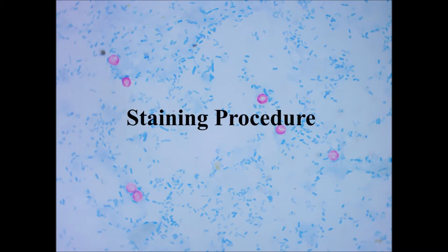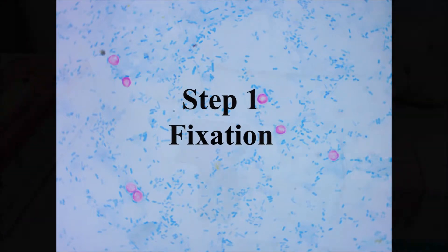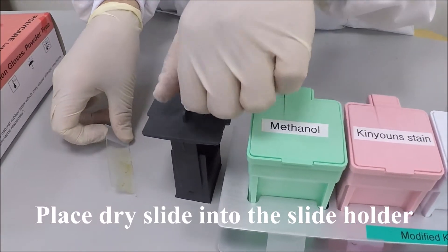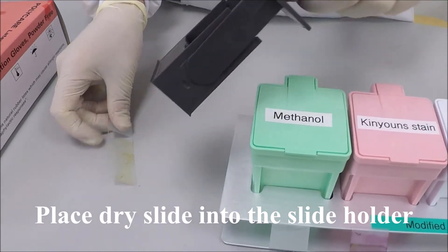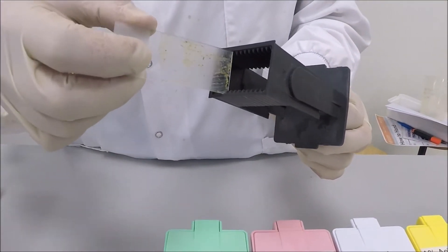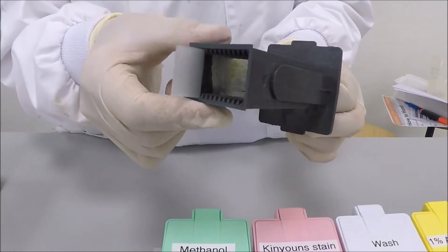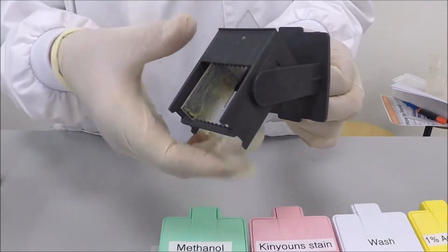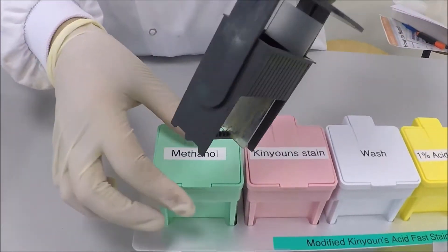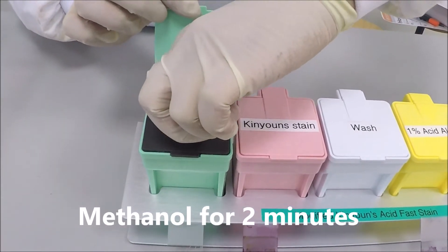Staining procedure. Step 1: fixation. Taking your dry slide, place it into the slide holder and place it into your methanol jar for 2 minutes.